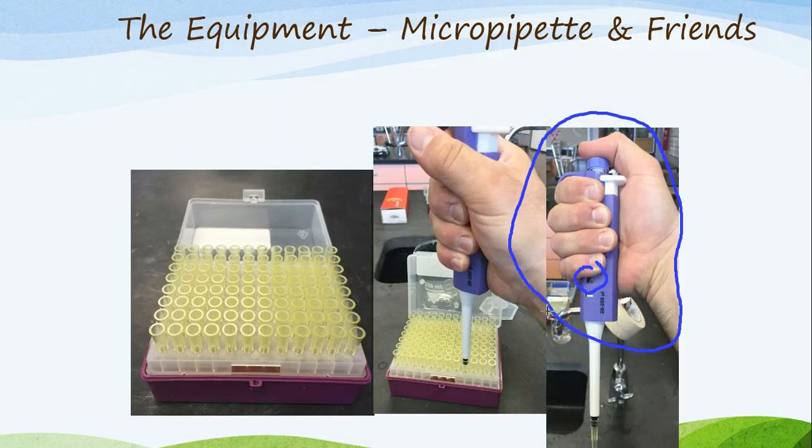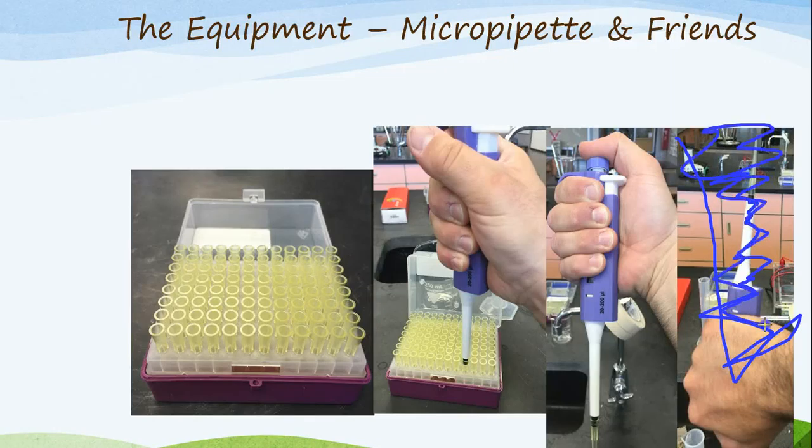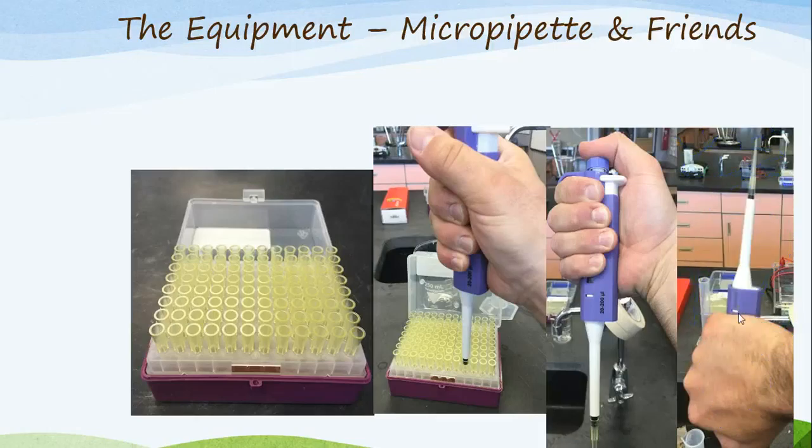And one very, very, very big and important thing is this micropipette is kept in the upright position with the tip pointing down. At no time, absolutely no time, do you want to tip a micropipette upside down. This is not good. Do not do this. Fluid, substance, liquid, whatever you're drawing up will travel down into the micropipette, ruin the calibration, and these things, let's just say, are not cheap.